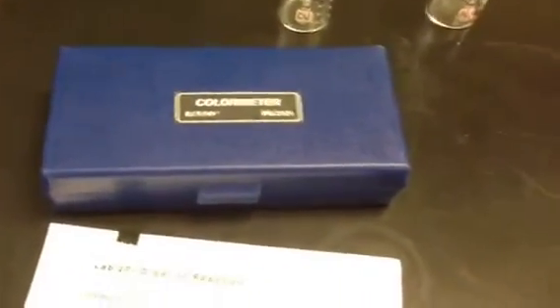You have your colorimeter, which you've taken out of the box and attached to the Spark. It just plugs into the very top, right there — it only plugs in one way — and it's connected to the actual colorimeter, and the thing is in there at the moment.